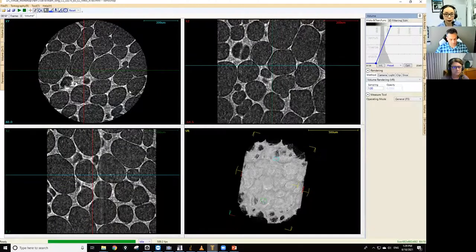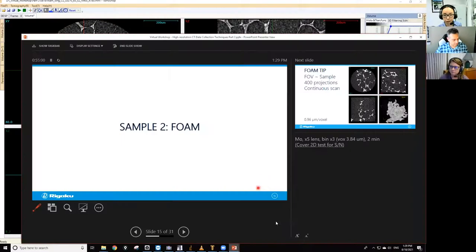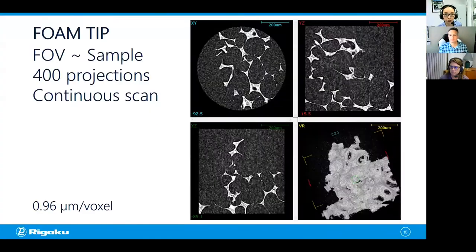So let's take a look at the other two scans as well and see what kind of a difference we see in them. So I'm going to switch back. Okay. So the first one, if you choose the tiny sample that has a little tip that more or less matches the size of the field of view, this is the scan you're going to get. The image quality wise, this is pretty good for a 2 minute scan.